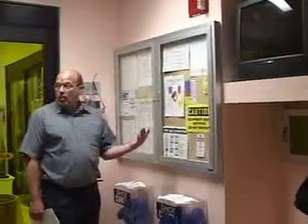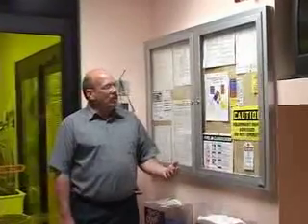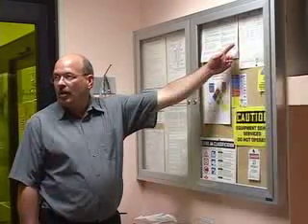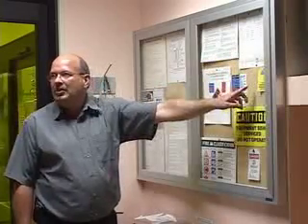This board shows a lot of the placards that normally would be posted on the door showing other hazards in the facility. I'll point out a couple involving X-ray, the NFPA fire diamond, and our lockout tagout signs. So let's start with X-rays. Basically, we have 7 pieces of equipment that are capable of generating X-rays. You will see this symbol posted on each of the pieces of equipment. They're typically electron beam systems.